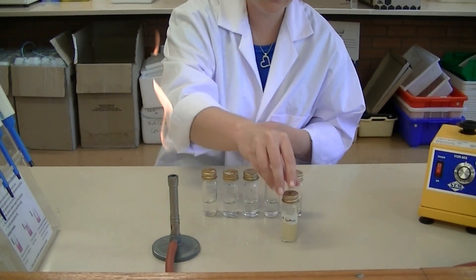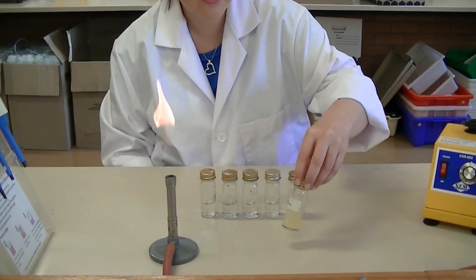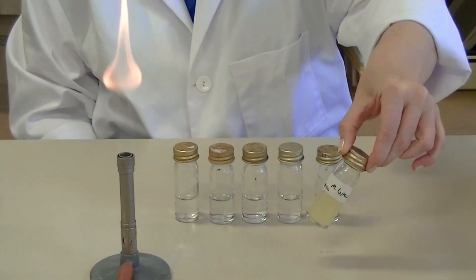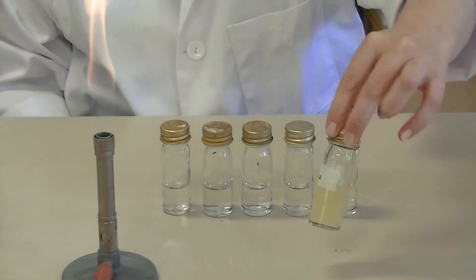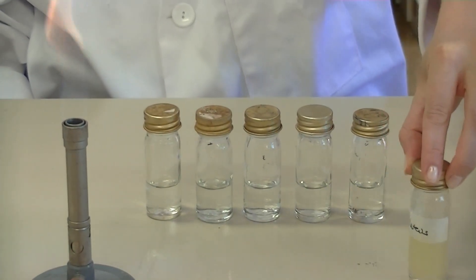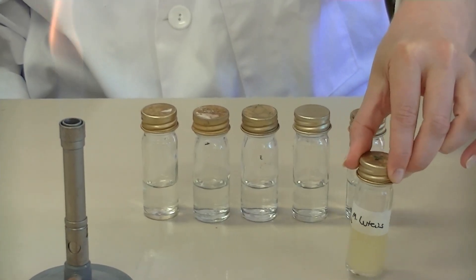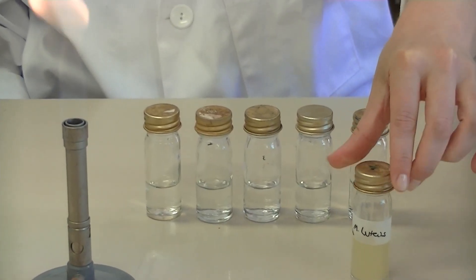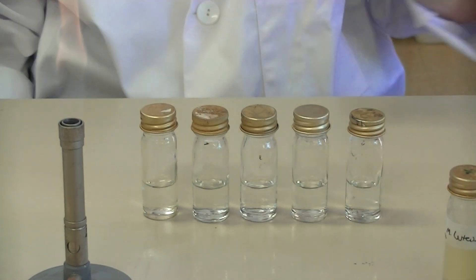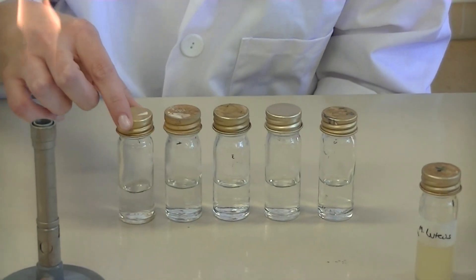On your bench you should also have a culture of Micrococcus luteus. You can see this McCartney bottle contains a bacterial culture — it is cloudy, and Micrococcus is also yellow in color. This is our stock solution, and this is the solution we're going to calculate the number of viable cells for by completing the serial dilution.